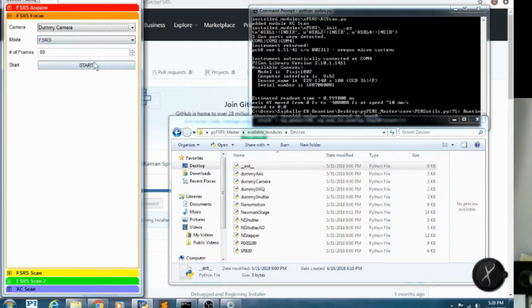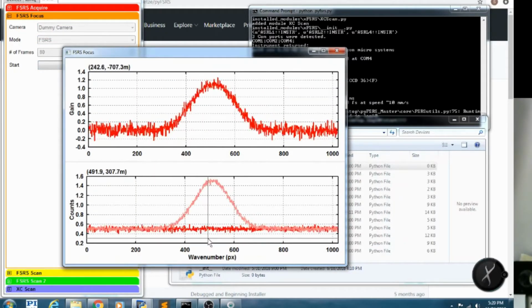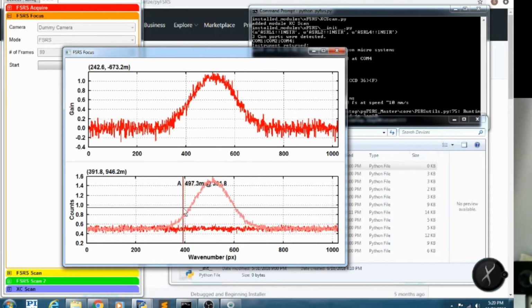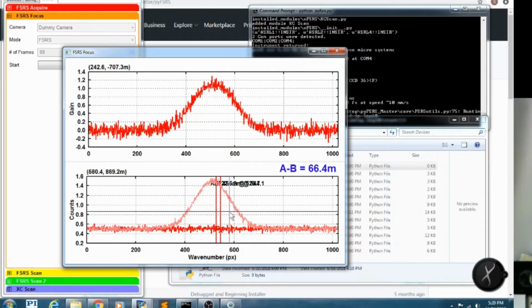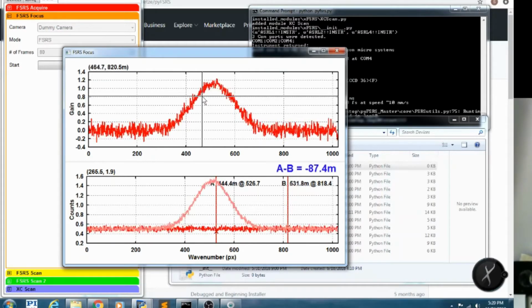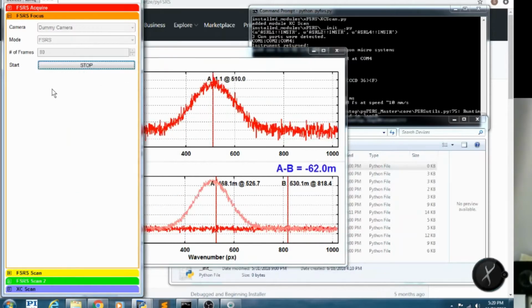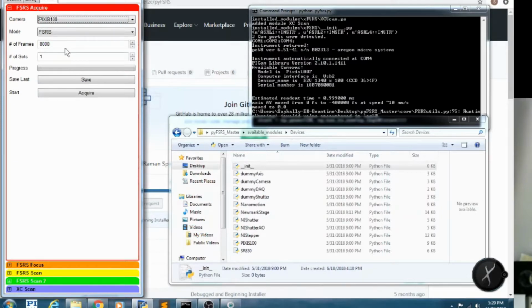Here we're going to tell it to average for 80 shots or 80 milliseconds. Here's the output. On the bottom you can see what would be the probe with the Raman pump off, and then this light trace would be the probe with the Raman pump on. And then the top trace in this case would be the negative log of the probe with the Raman pump on over the probe with the Raman pump off. And so this would let you tune up on your signal.